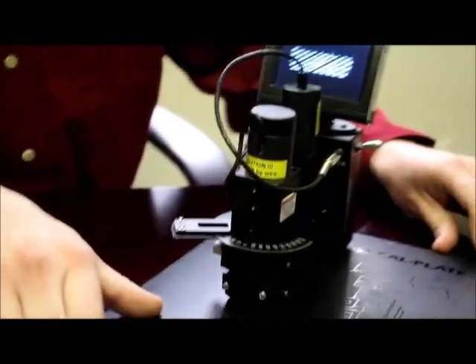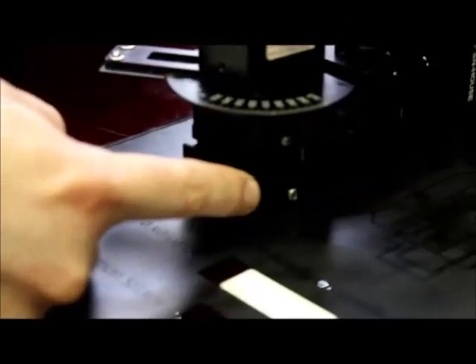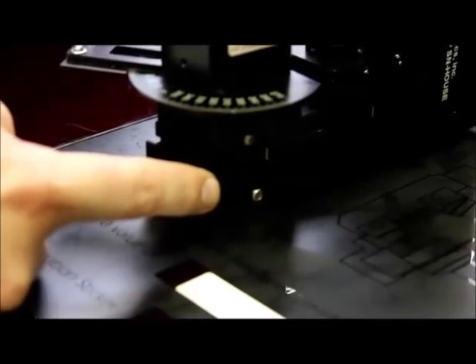We can make a similar adjustment on the opposing side of the GASP instrument using the mirror lever, which is down here. I can simply move that mirror lever up or down so that we can essentially again center the image right in the middle of the screen.